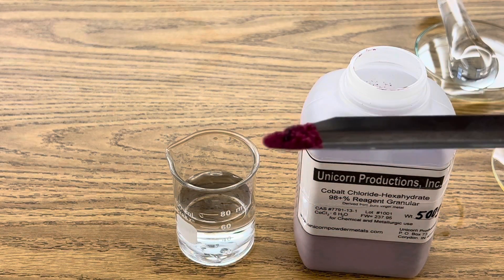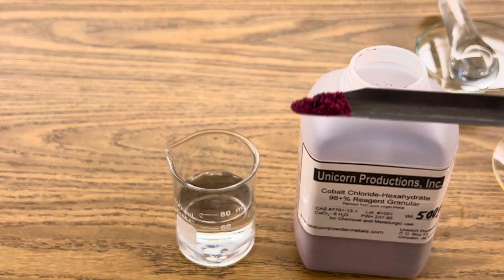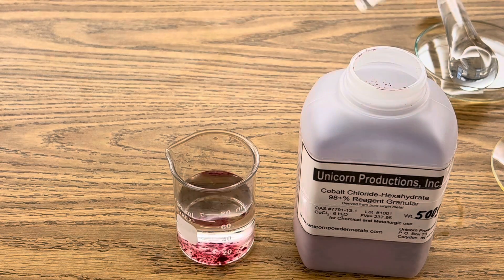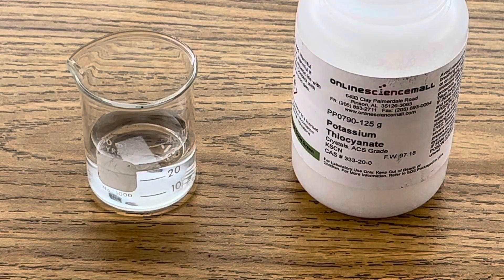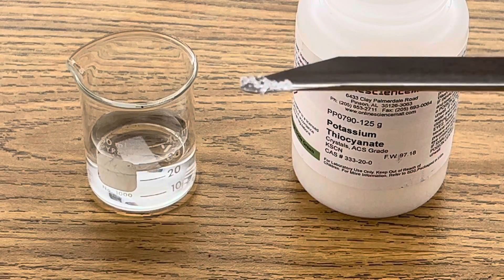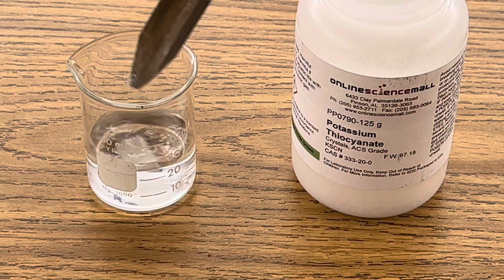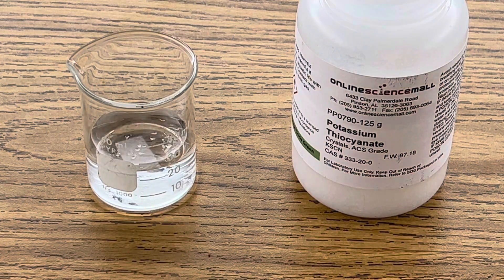The first step is to add two grams of cobalt chloride to 60 mils of distilled water and stir the solution until it's aqueous. The second step is to take just half a gram of potassium thiocyanate and add it to 20 mils of distilled water and stir until aqueous.